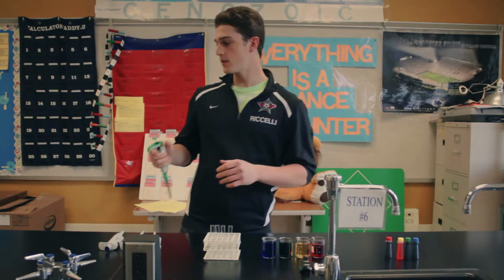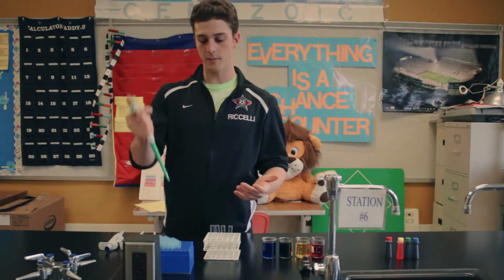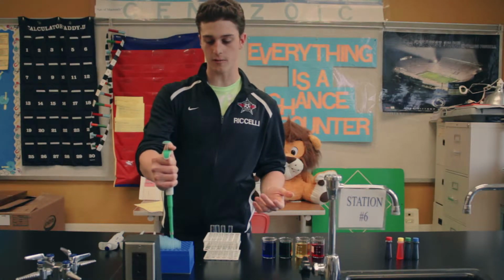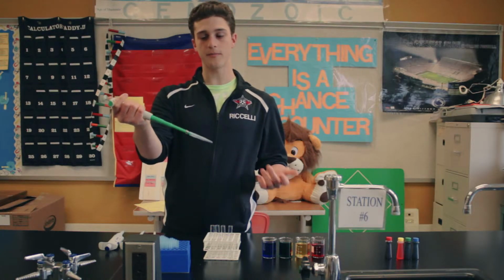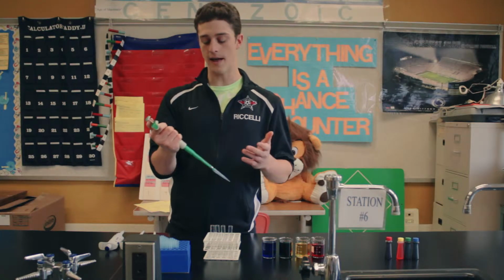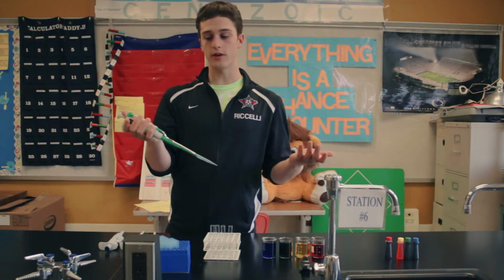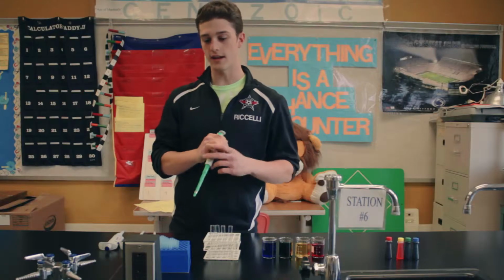When you're ready to use it, all you do is take a tip and set the tip of the micropipetter right in like this, and you're going to get your tip, and then you're going to take your sample, and Maggie's going to show you how to do that. And then whenever you're finished, you just push this button and eject the tip.